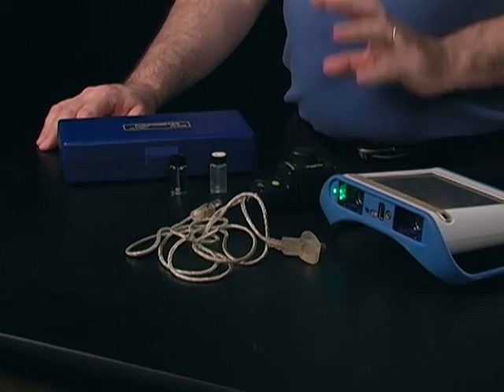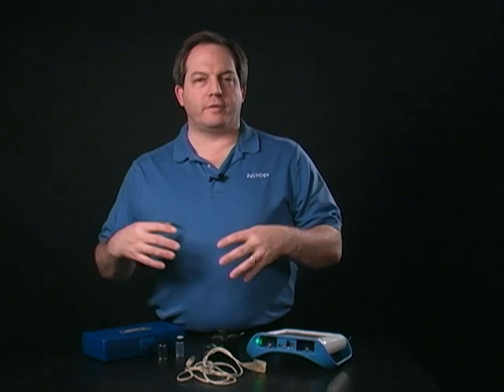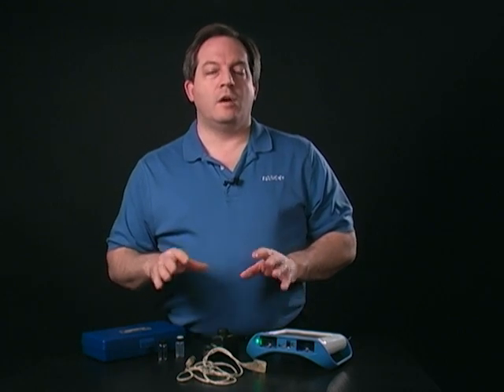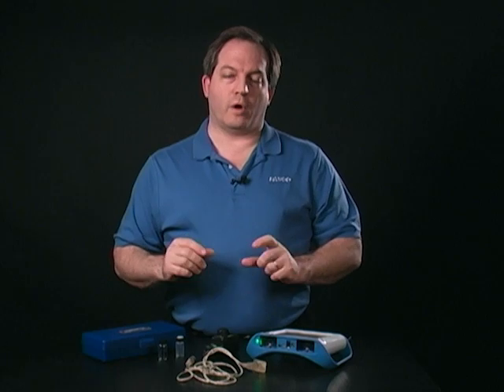Hello and welcome to this quick look at the turbidity sensor. The turbidity sensor is used to look at the amount of material that's present in a sample of water. This would typically be used when you're doing a water quality study, or if you were looking at the growth rate of something in the water sample.